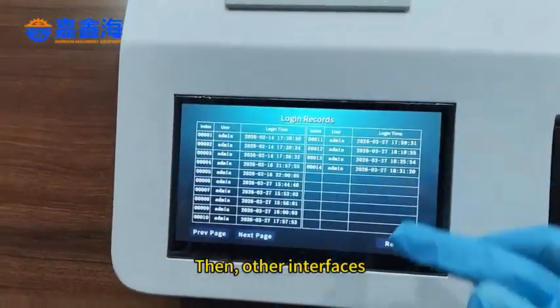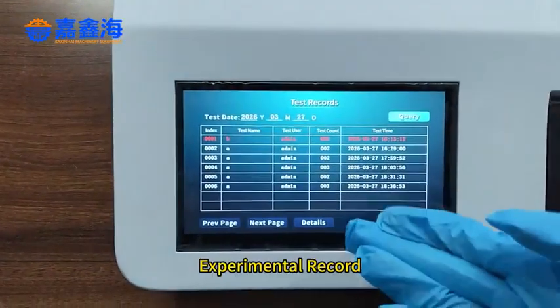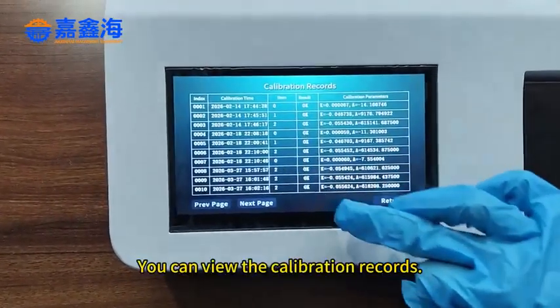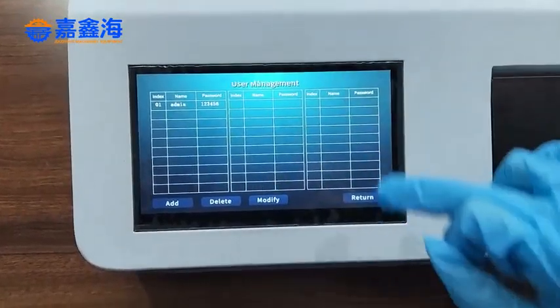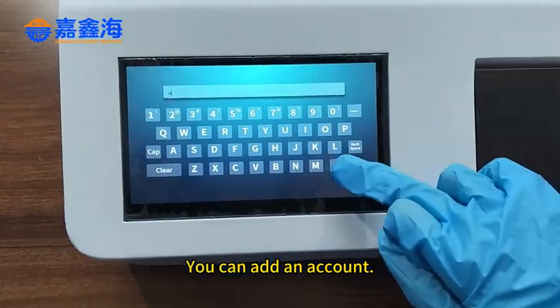Then other interfaces. Login records. Experimental record. Click to view the record. You can view the calibration records. Account management. The first one is the main account. You can add an account.